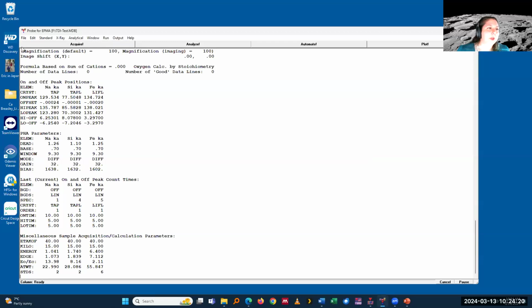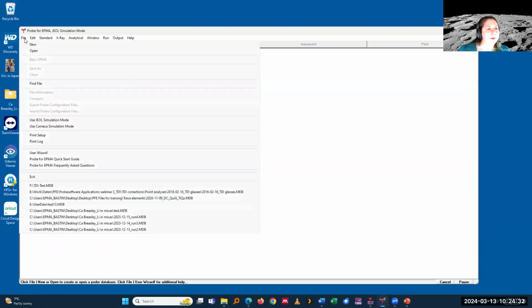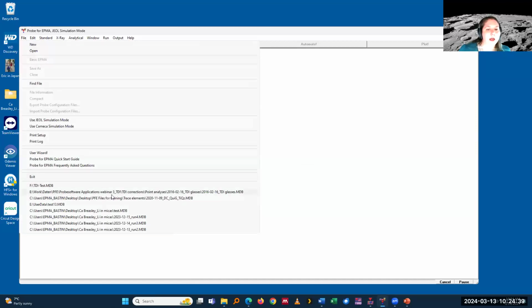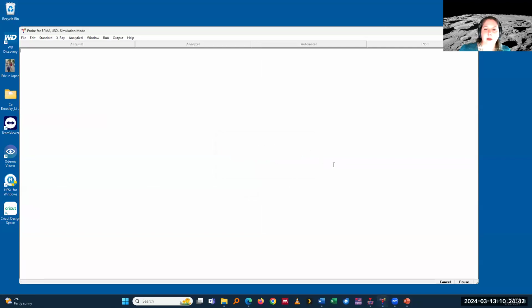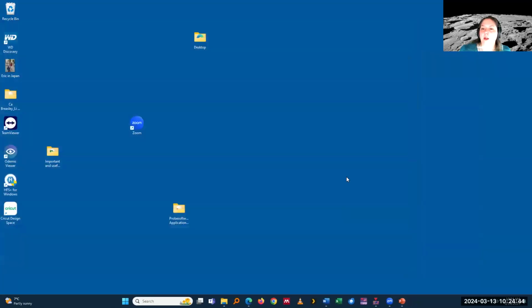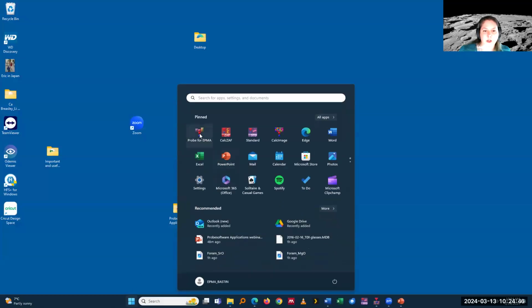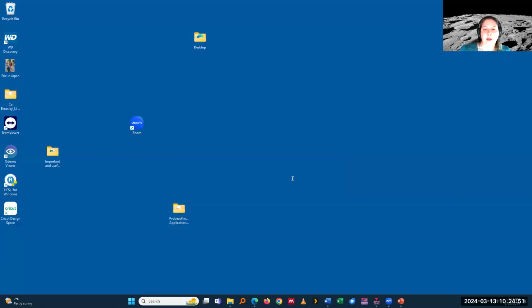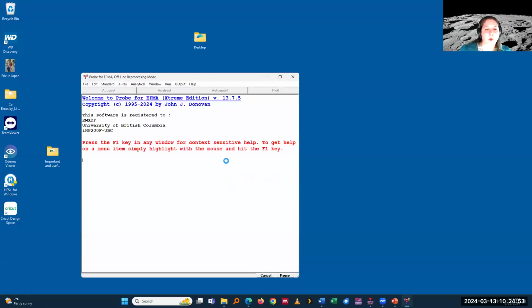Okay, so what happens now if I've done my analysis and I have data? Oops, that was actually the wrong one. Okay, I don't know why all of a sudden I had that all open earlier. Let's just open that again in processing mode.